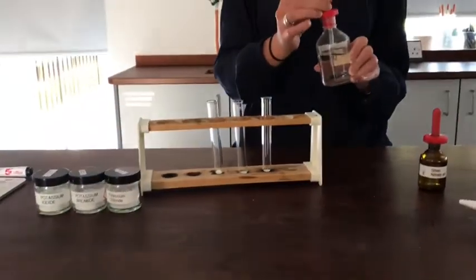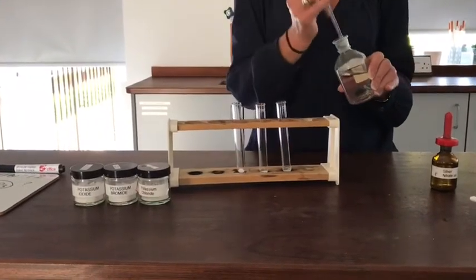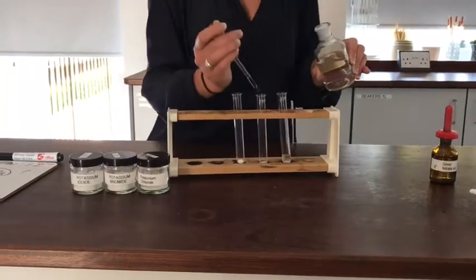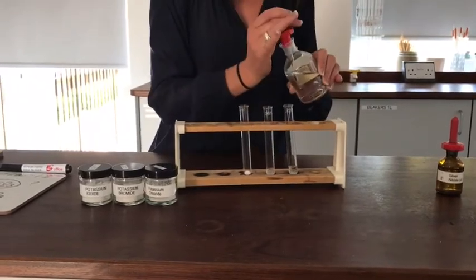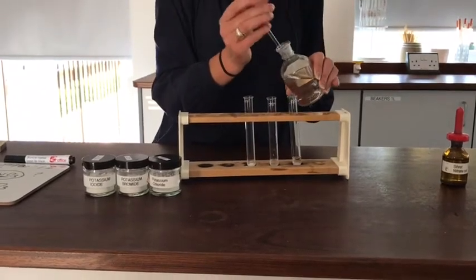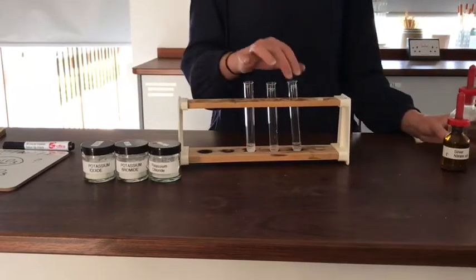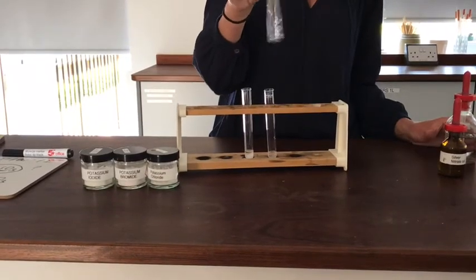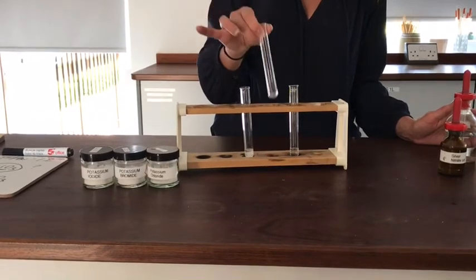So I'm going to add some nitric acid to each of these in turn in order to make them into solutions. I'm expecting that when I add my silver nitrate to it, I should make precipitates, a different precipitate in each one. So in the sample containing the chloride ions, I should make silver chloride. In the one containing my bromide ions, I should make silver bromide, and the final tube should end up forming silver iodide. Okay? Now, these silver precipitates, silver chloride, silver bromide, silver iodide, all have different distinctive colours.